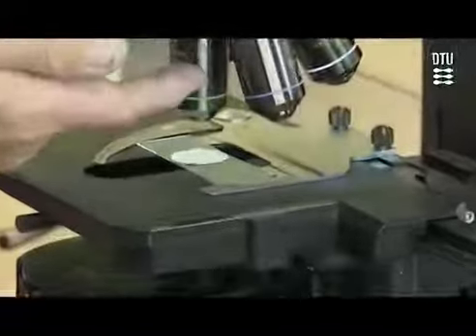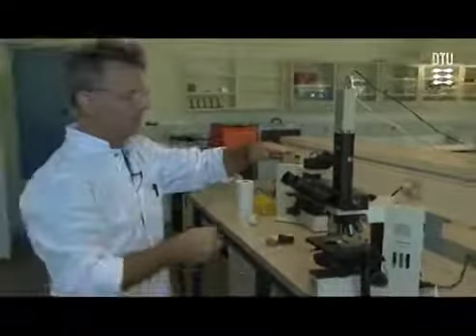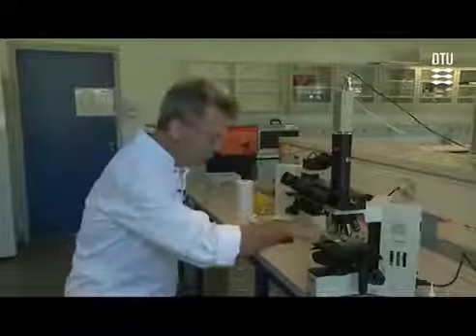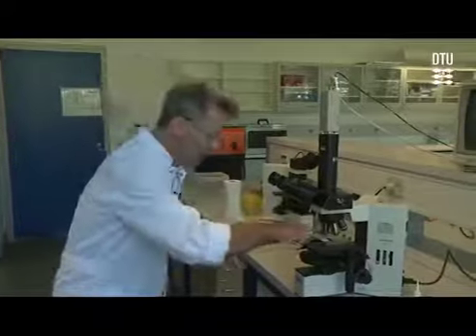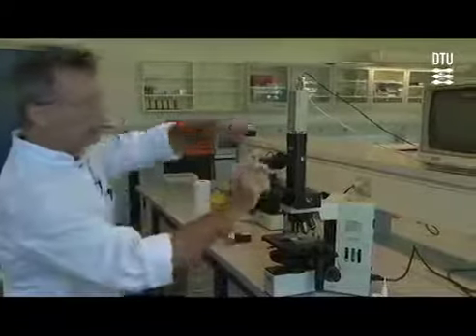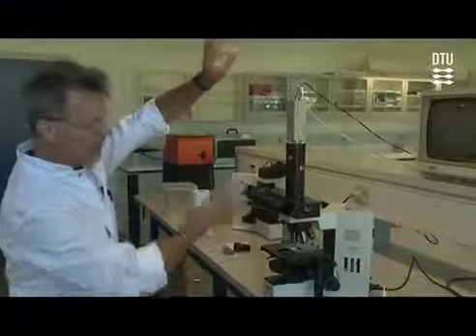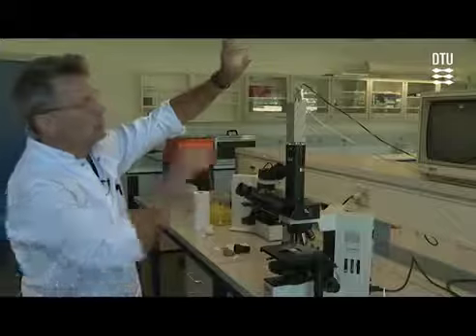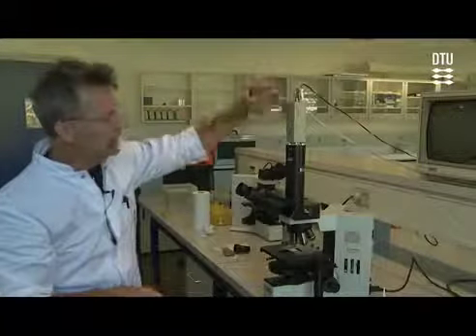But if something now sits where the specimen is, on top of the cone of light, and it is reflective, then the beams of light will not go straight through the ring, but will be mirrored away and end up in other places. So they will, for instance, move in totally different directions but end up in the same place. And if you have direct light going to the same place, then we have positive and negative light that will annihilate and end up giving black, no light.